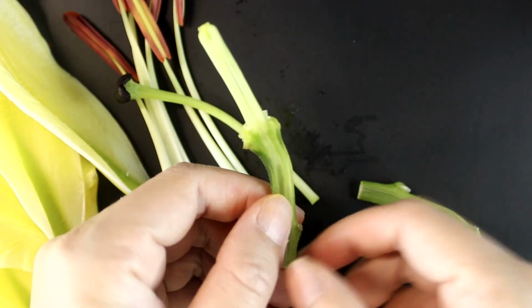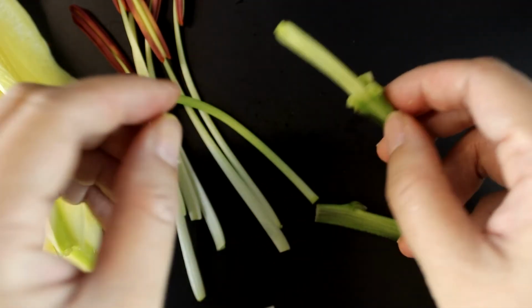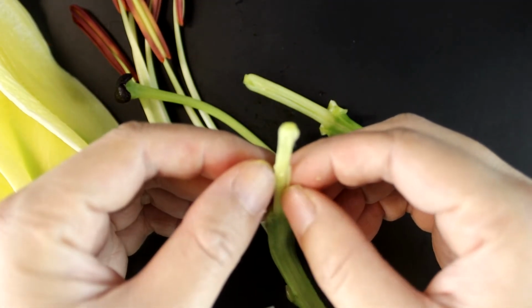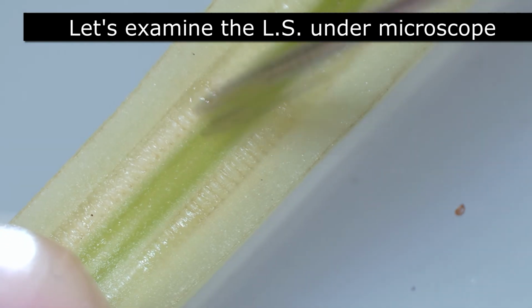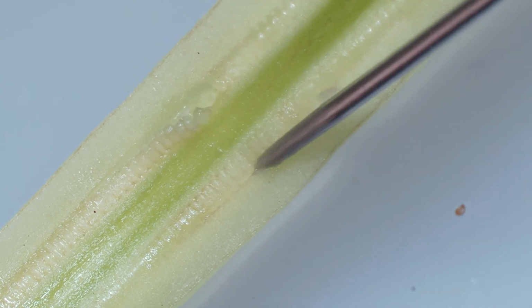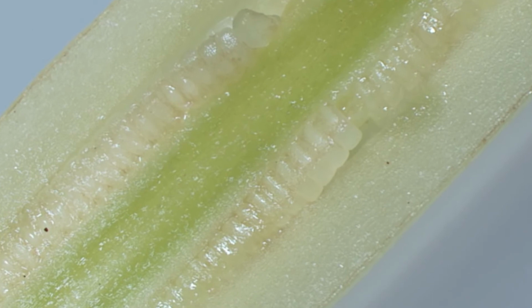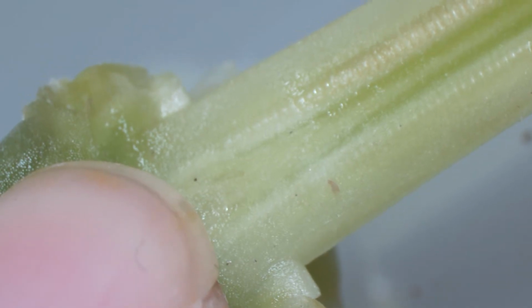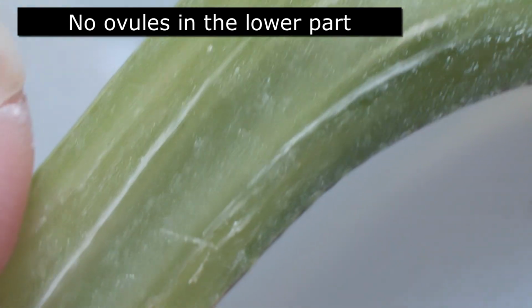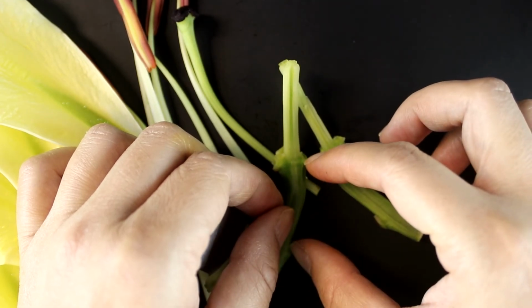Here you can find the ovary if you look carefully, because you can find some ovule-like structure. Of course, we should look closely under the microscope in order to confirm it. So this is the ovary, and this is just the receptacle.